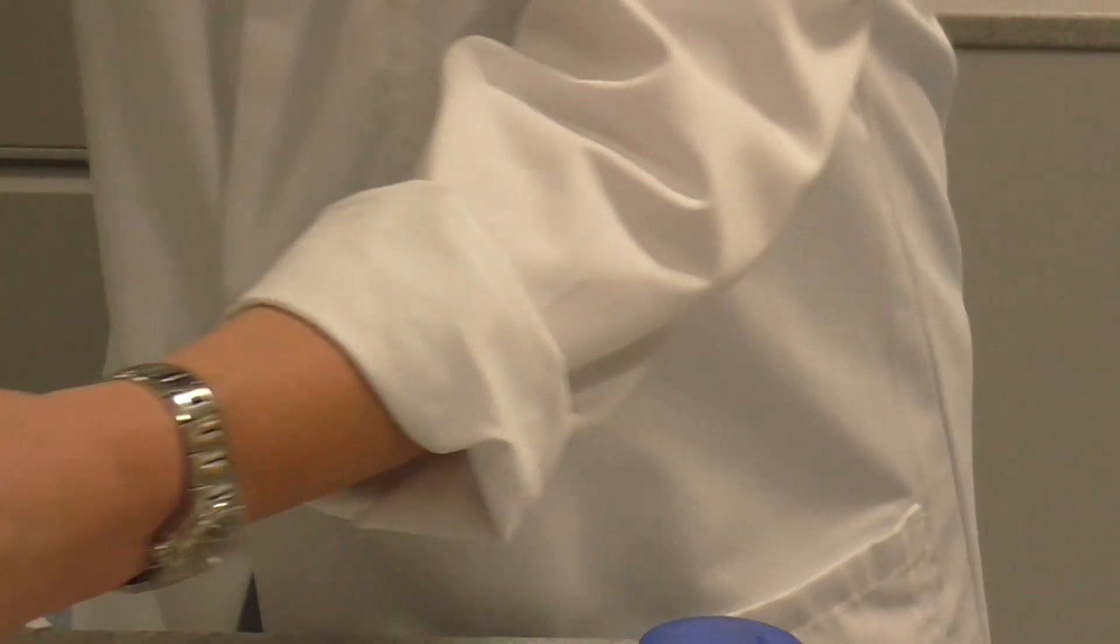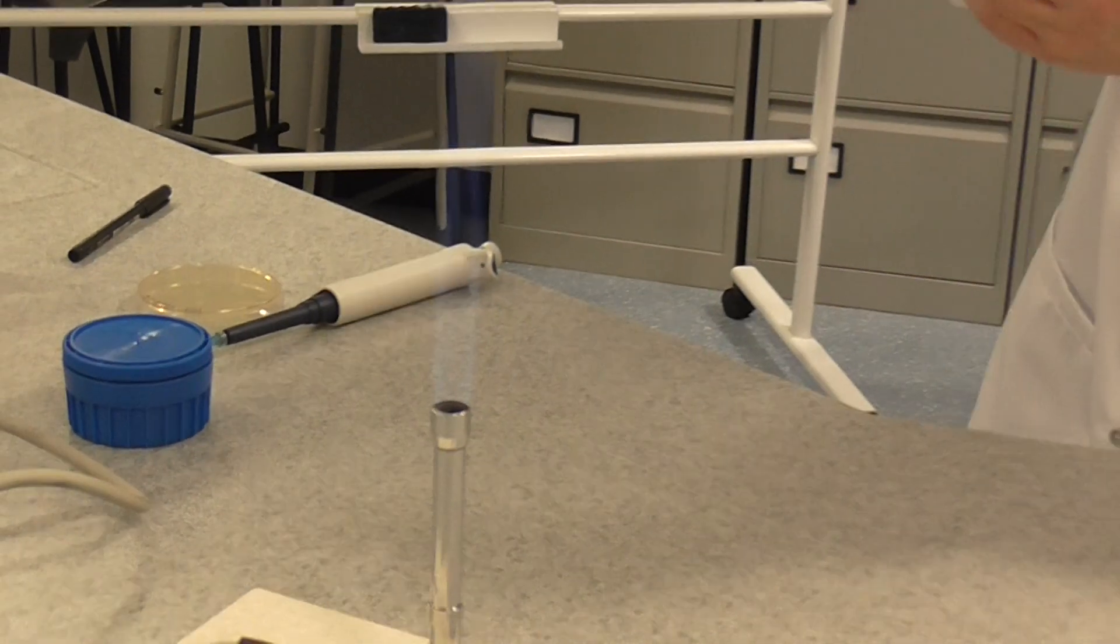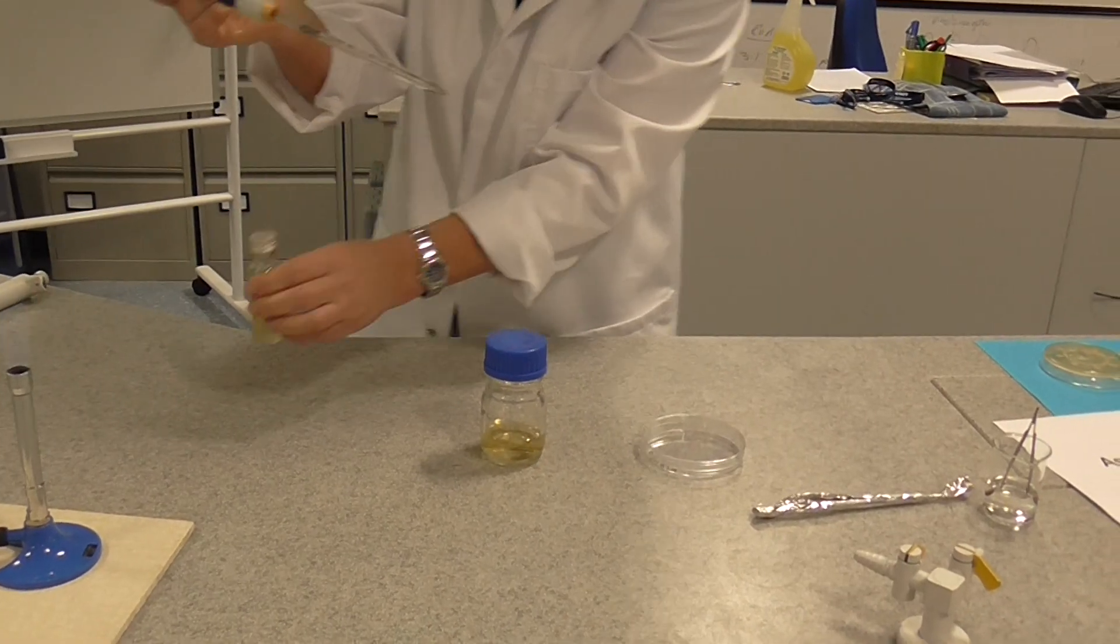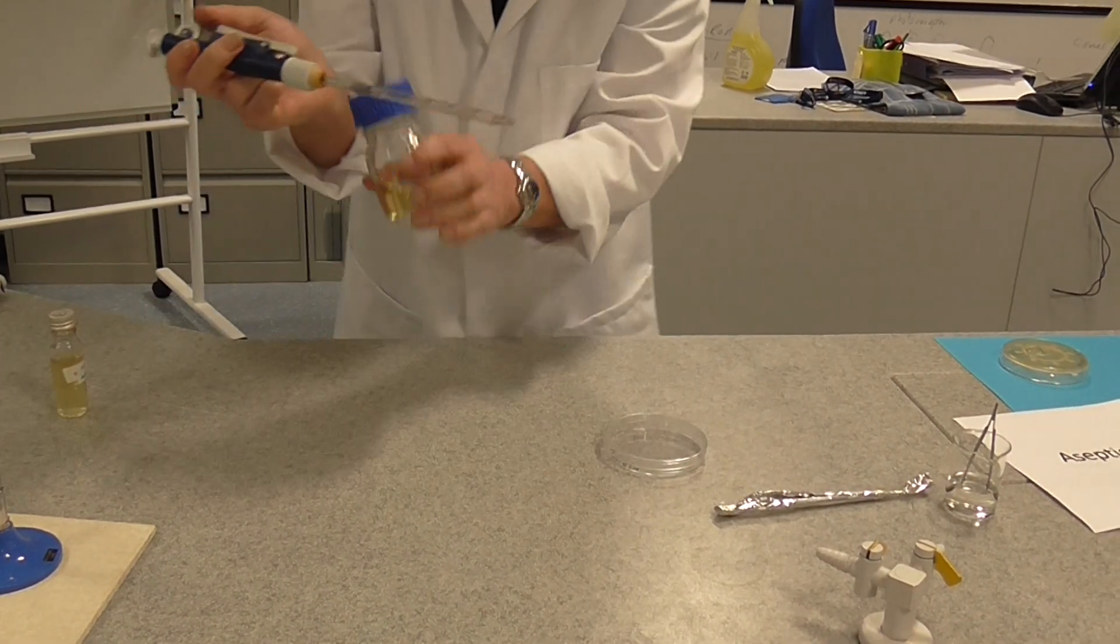I'm going to re-flame the bottle top and I'm going to replace the lid. We've now finished with that.